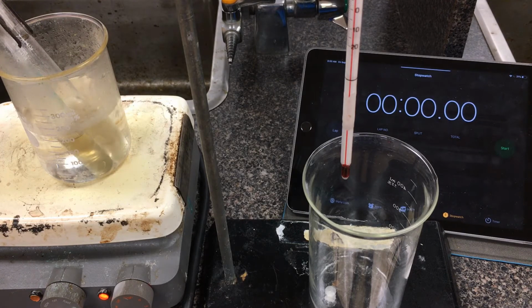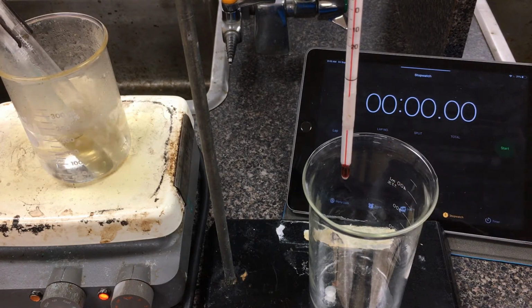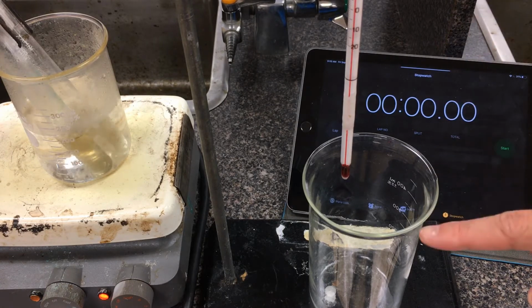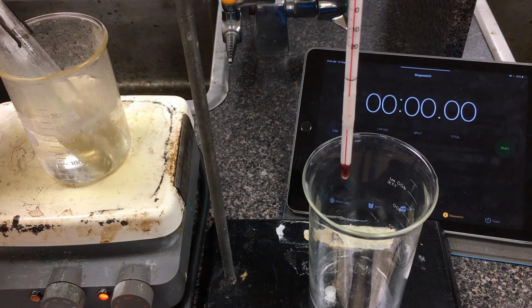So how we're going to set this up here is I'm going to take the stearic acid from the boiling water. It's already inside these test tubes here. I'm going to be placing it in this beaker here just as a nice stand. I'm going to lower this burette stand here so the thermometer can equilibrate to the temperature of stearic acid. When it starts to cool down, I'm going to start my stopwatch, and I'm going to be reading out to you the temperatures in 5-second intervals. I want you to note down these temperatures here so that we can actually plot this as a graph later on. So I'm just going to pull the stearic acid.